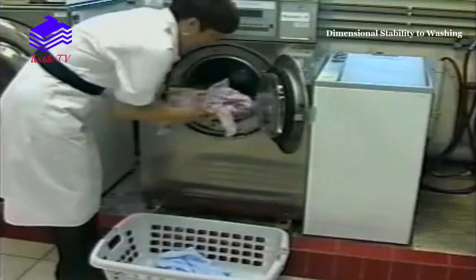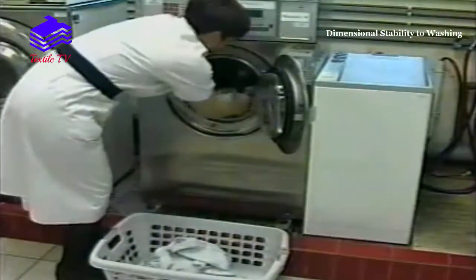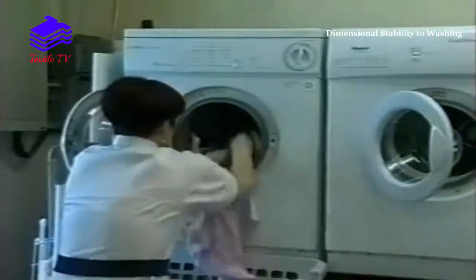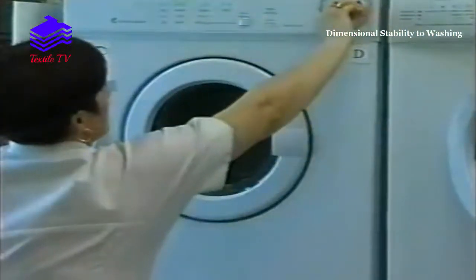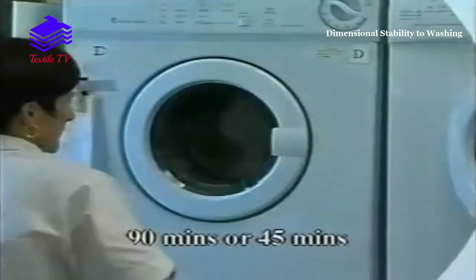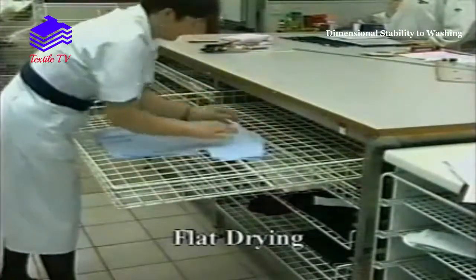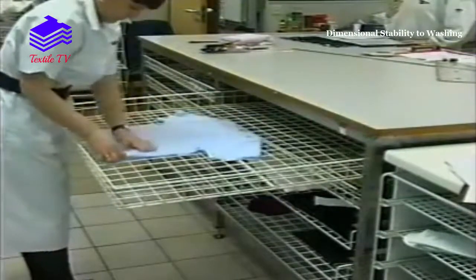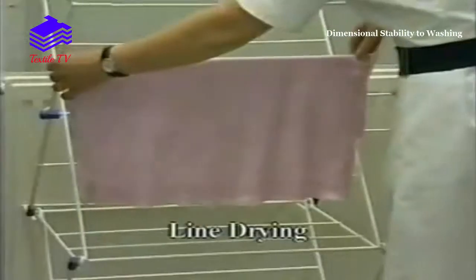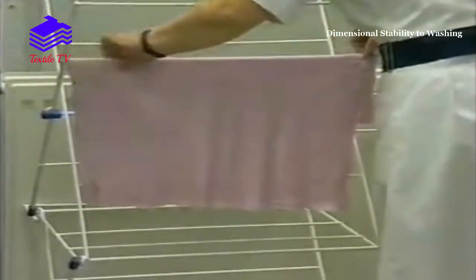The specimens are removed and dried in the desired manner — tumble, flat or line. A total load of 1kg is placed in one of the tumble dryers and the time is set for either 90 minutes or 45 minutes. Flat drying is done by laying the specimen on plastic-covered mesh trays. Line drying is done by folding fabric over a frame or hanging garments on hangers.